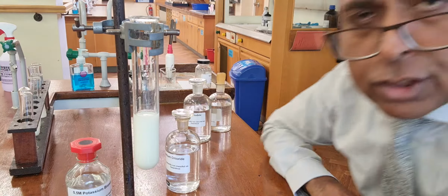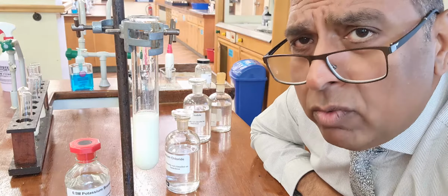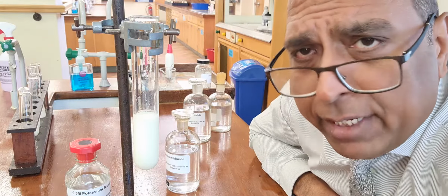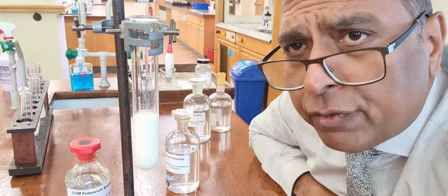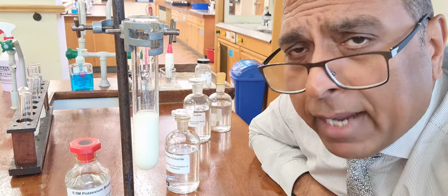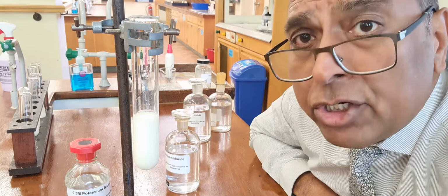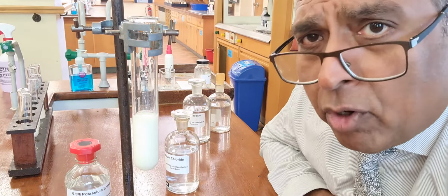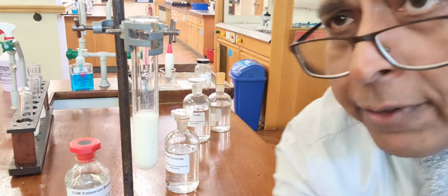Now, I know it's not so easy to see the colours, and that's why at A level we add ammonia at the end to check which is which, but that extension with ammonia is not part of GCSE. So GCSE, we just learn those 3 colours, white, cream and yellow, and they tell you whether you've got chloride, bromide or iodide, because silver chloride is white, silver bromide is cream, and silver iodide is yellow in colour. Let's carry on with our PowerPoint.